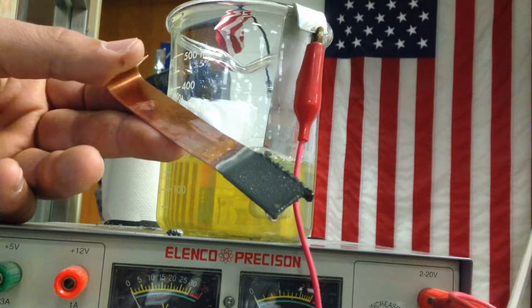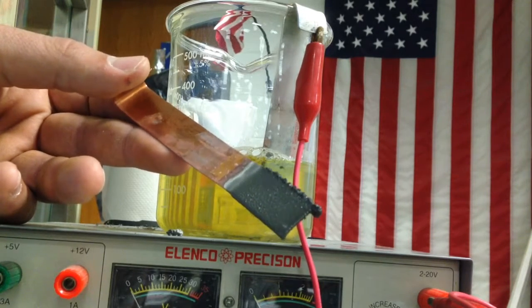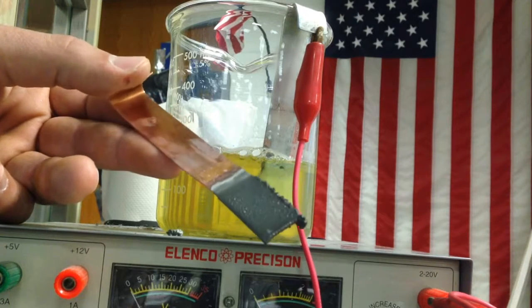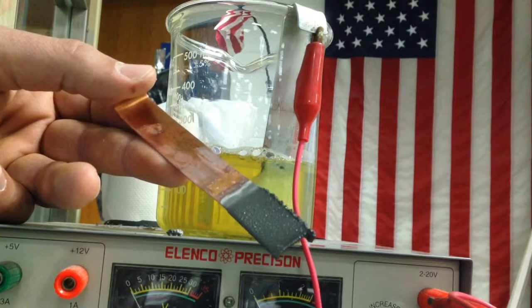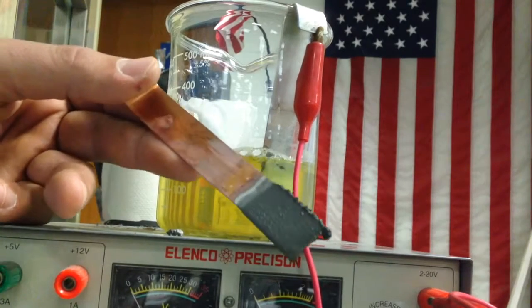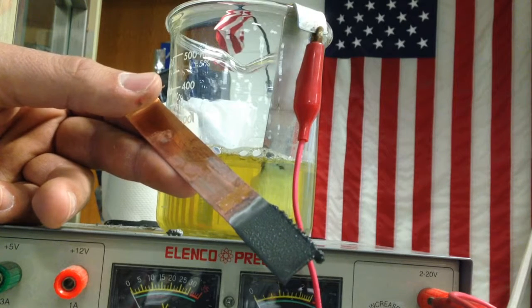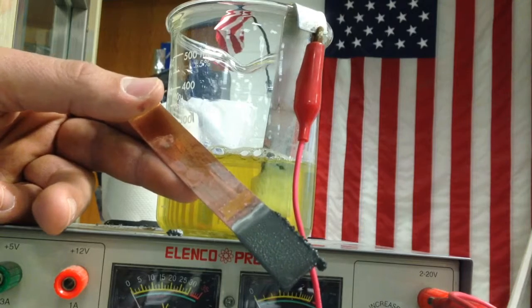If I had a molten solution like we do in industry, it would be a pretty nice lustrous, silvery metal here. So clearly we forced plating that normally didn't occur. We forced a redox reaction to occur by electrolysis. Now, the interesting thing here is that I can predict and calculate how many grams of tin will plate, and that's an important procedure using something called Faraday's constant. We're going to do that right now.